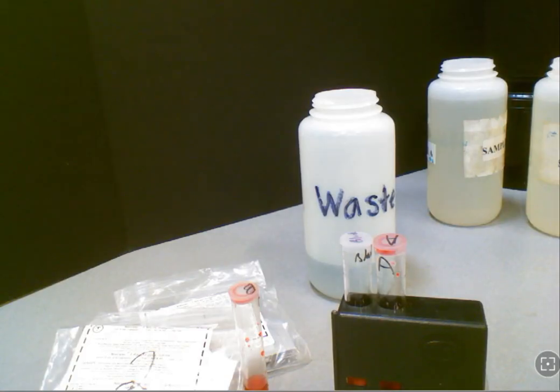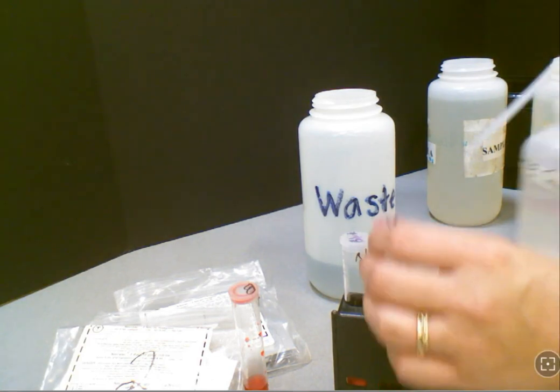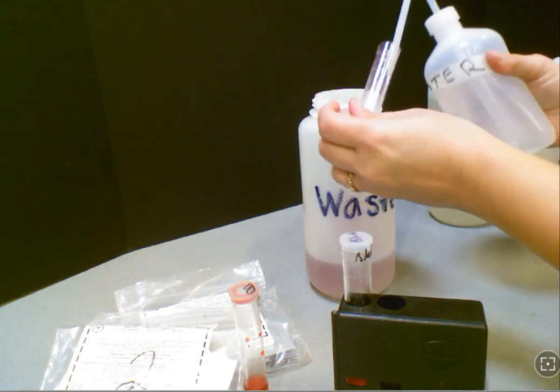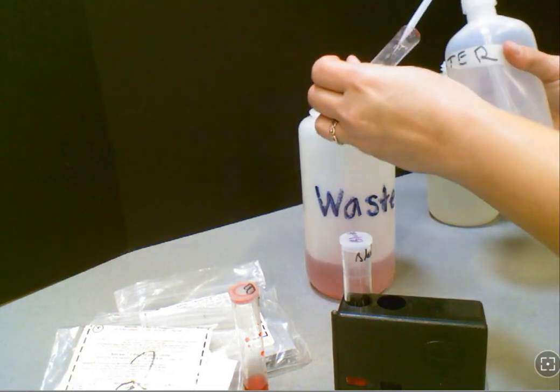Repeat this test for sample B and report those results, and then once you're finished you can use your waste container to empty out all materials. And don't forget to rinse out your test tubes and clean up and return everything in the same way you found it.